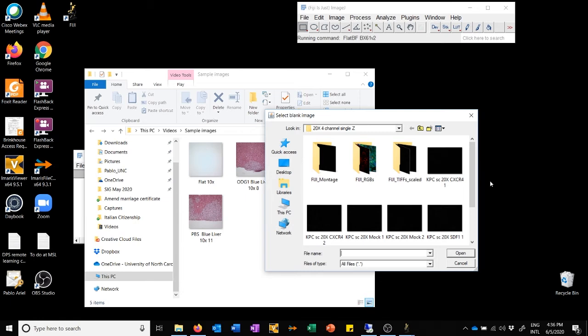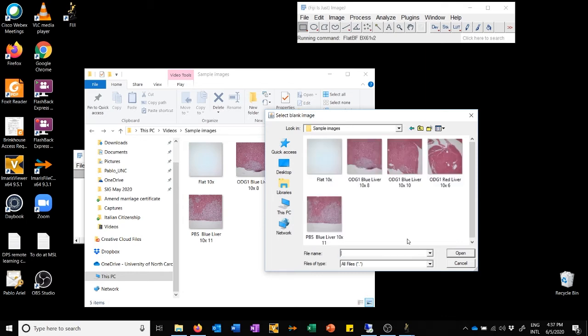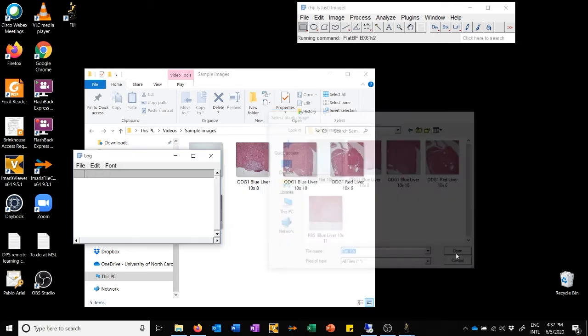To make things a little bit faster, I have copied the location of this folder and I'm going to paste it here so we don't have to go crawling through my file space. Just going to hit enter. And so now we're in this folder, which has both the actual images that I want to adjust and the blank, which is this one. So I'm going to select the blank image and say open.